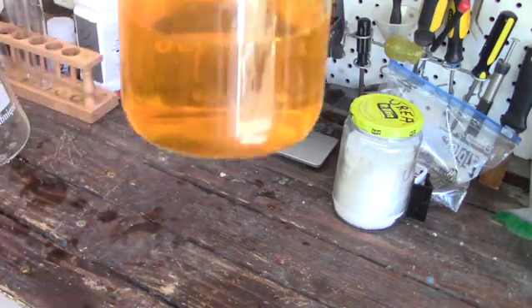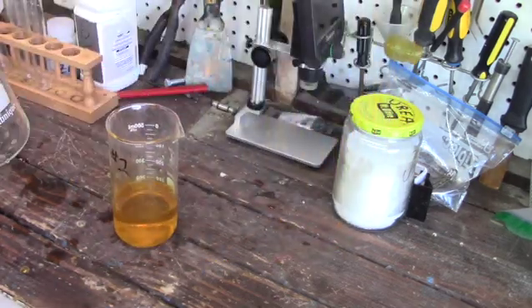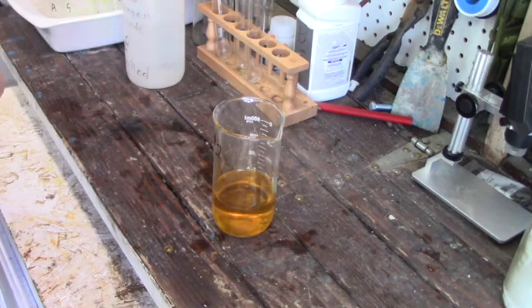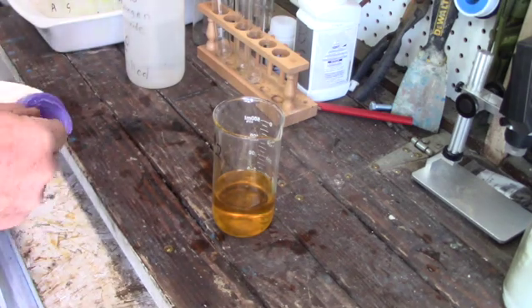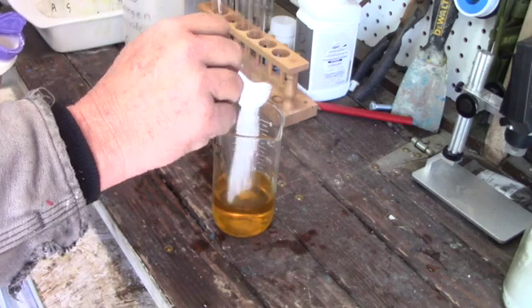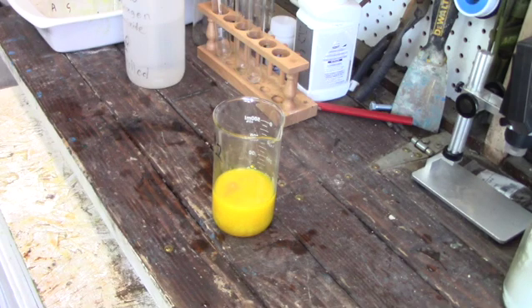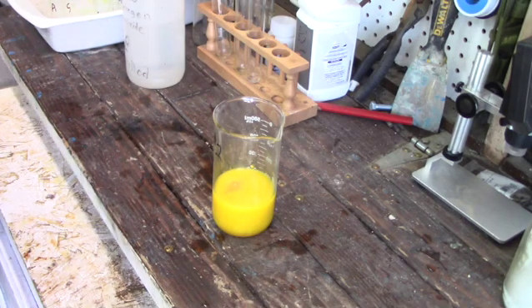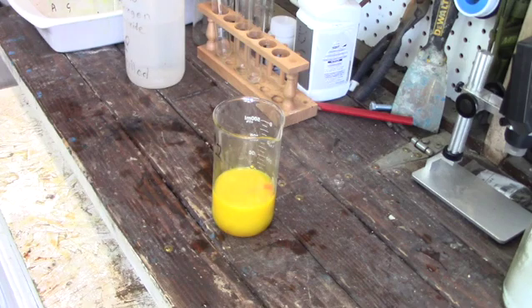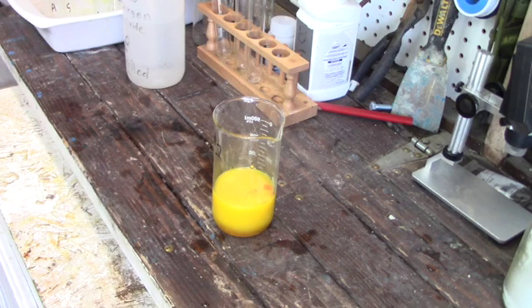So here's the SMB — sodium metabisulfite. You're adding this sulfur-containing powder to a solution that contains chlorine in hydrochloric acid form, and they combine together and put out chlorine and sulfur gas. This is not something you want to be doing without holding your breath or without a gas mask. If you're not in a fume hood, I wouldn't do it. I have a respirator on right now — if you can't see it, it's off camera — but this is some really noxious gas.